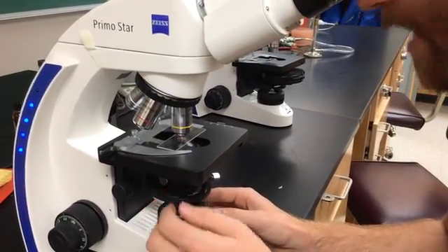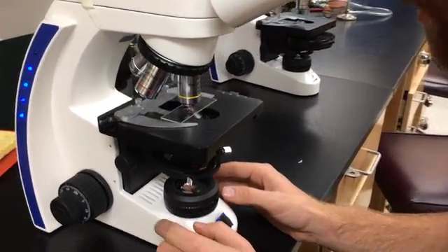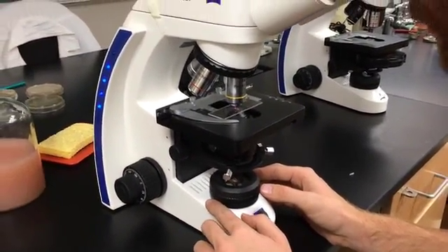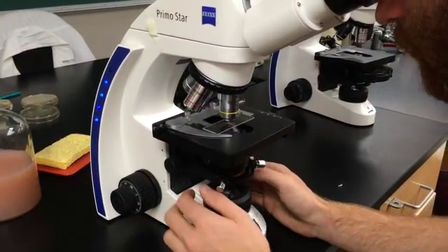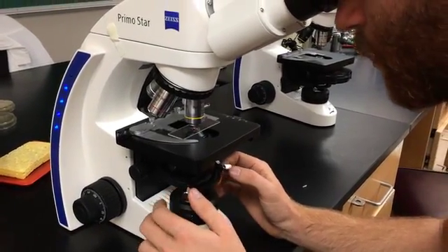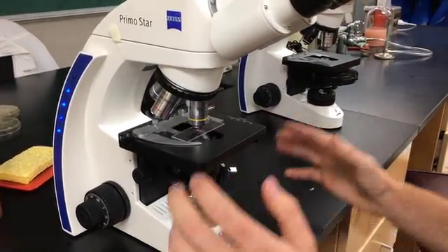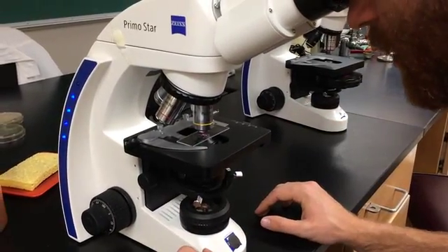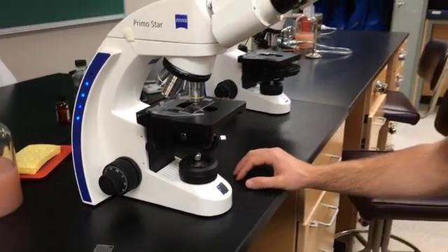And now each edge, each corner of this shape is now touching my outside field of view. And it looks good. And now I'm just going to open it just past my field of view. So my whole field of view is illuminated. Now I'm aligned at the 10x, and I should be pretty much aligned everywhere else.